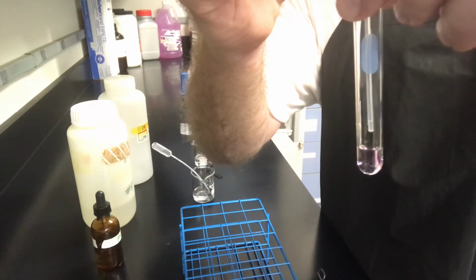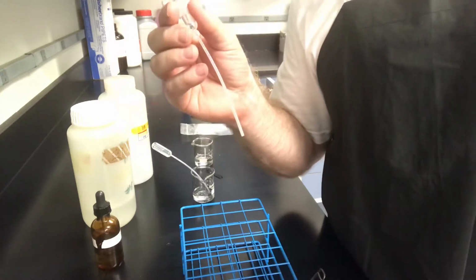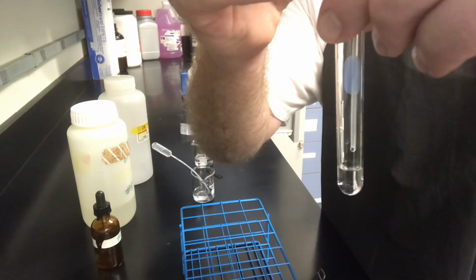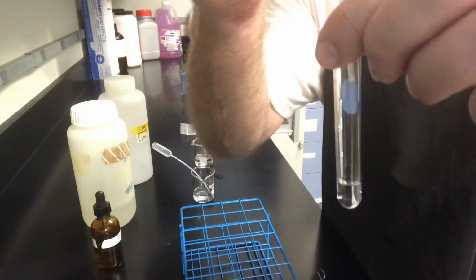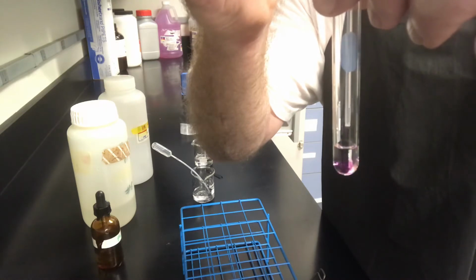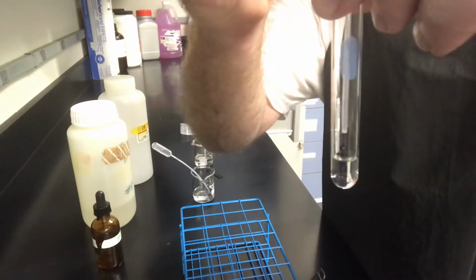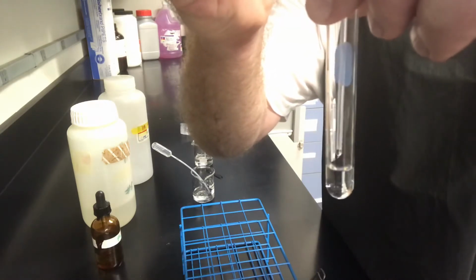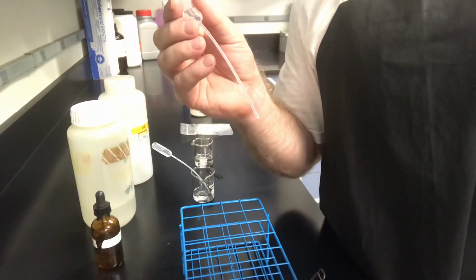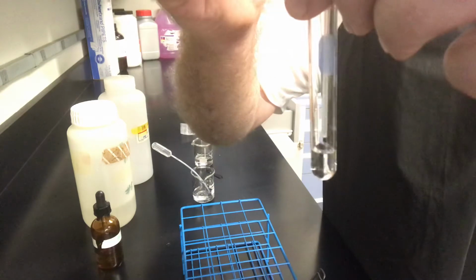21. 22. Still not staying. No, that's an air bubble drop. No, we don't want you. Get out of there. 23. Still not staying. 24. I bet it's going to be one more, 25.